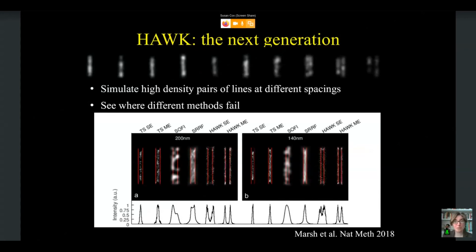Separating the fluorophores or emissions into more frames allows us to do more accurate fits. And even though, because we effectively have very high background here, because we have fluorophores overlapping all the time, your precision, especially in single emitter, might not be terribly high, you do see that separation. You do get something that's roughly the right size. And you're not getting artificial sharpening. So we were very excited by this because it seemed to promise that you could get back very reliable structure.